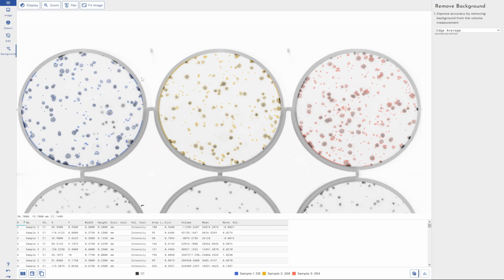Another thing to note is, of course, it being a Phoretix piece of software, we can template all of this and have it automatically applied as a template. So again, in the scenario I described, where you've got a very standardized workflow, sensitivity settings, things like that, you can automate all of that, perform all of that once, save it as a template, and just load the same template every single time and get really reproducible results for your ELISpot experiments, and again, in a 21 CFR GMP compliant manner, if your lab requires that level of compliance.